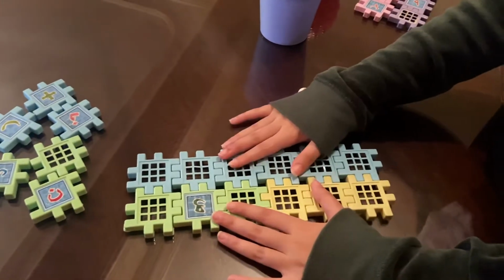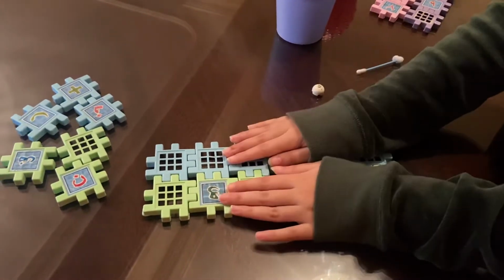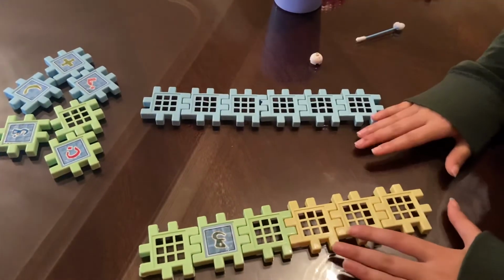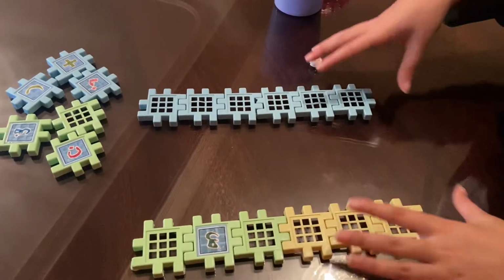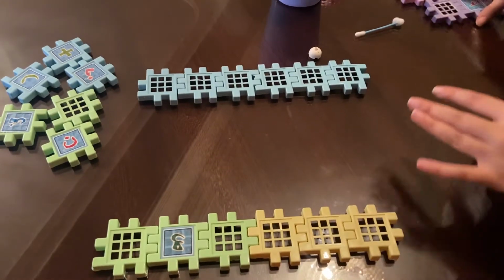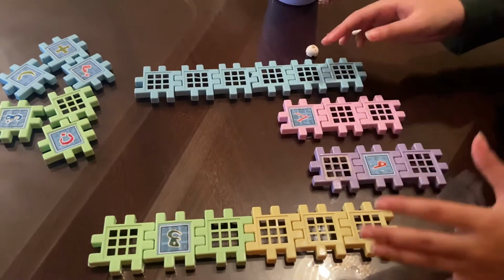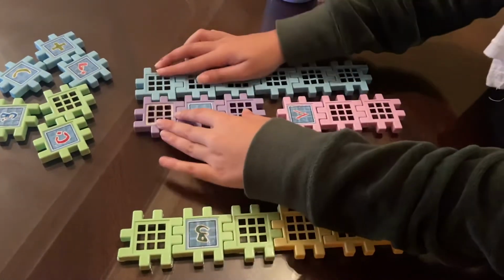So this new DNA goes through denaturation, where it is heated, and this breaks the bonds between the DNA, making it have two separate strands. So next is the annealing process, where the sample is cooled, allowing the complementary primers to bond to their complementary DNA, like so.